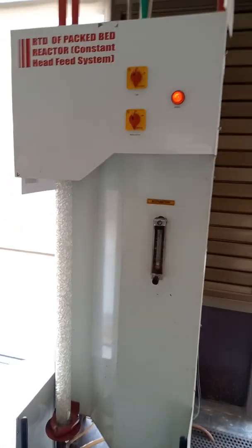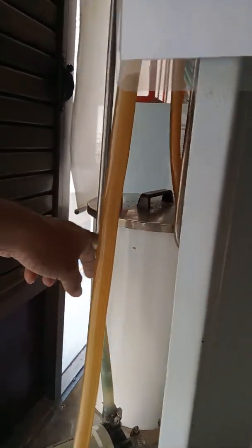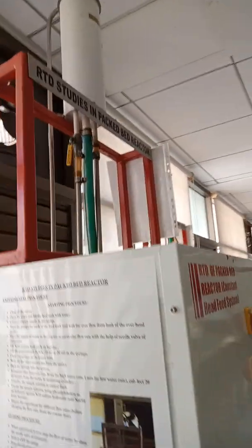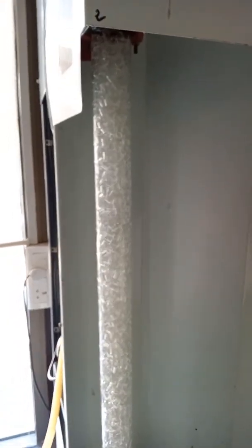Hi students, today we are going to perform a packed bed reactor experiment to find RTD studies. Since you could not come today, we thought to do a sample run and show how we are going to perform the titration studies with the help of our lab assistant. We are about to start the experiment. The water is in the reservoir tank and we are going to start filling the overhead tank so that it flows to the packed bed reactor bottom.